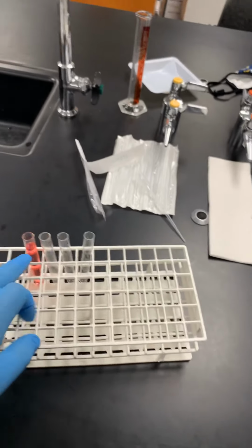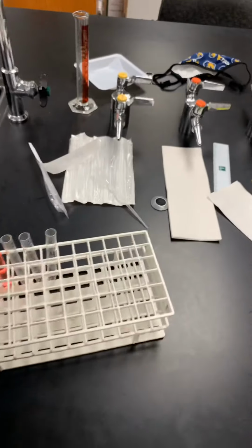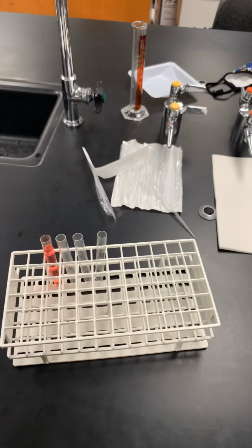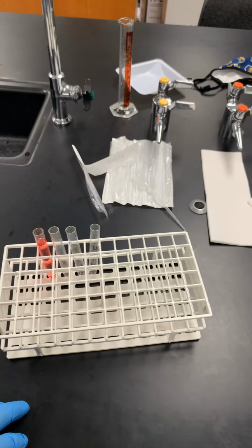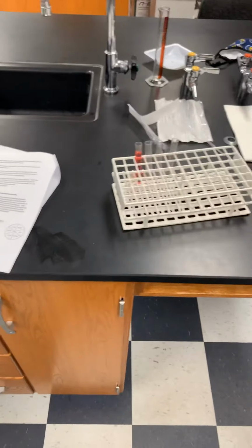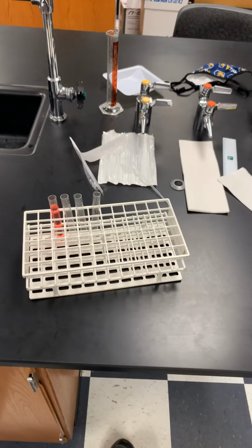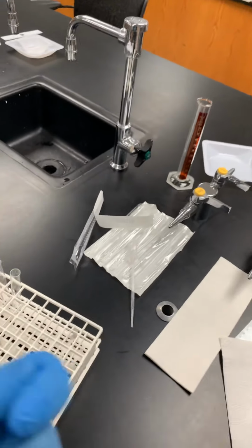So if you had a concentration of 1 drop of food dye per 8 milliliters of water, and then you take that concentration of food dye and add more water to it by taking some part of this and putting it into that test tube, you've now diluted your concentration. So instead of having 1 drop of food coloring per 8 milliliters, you now have something else, and that's part of the lab, for you to figure that out. So we ask you that, think about that. What would it be if you do a 2-fold dilution of that? What does it end up being?